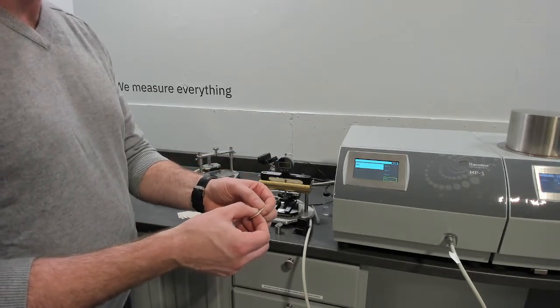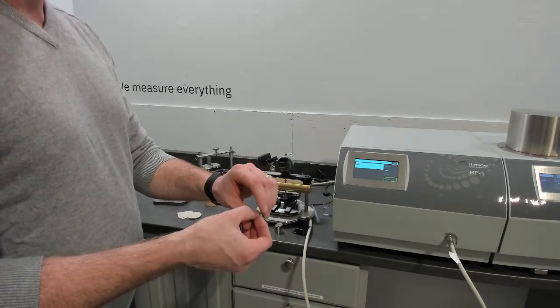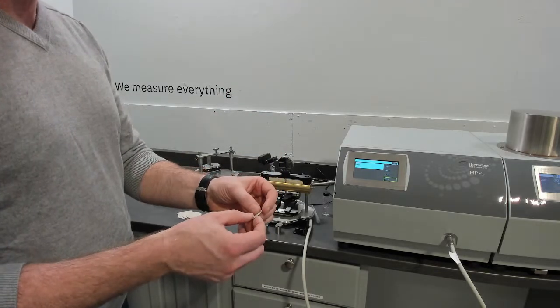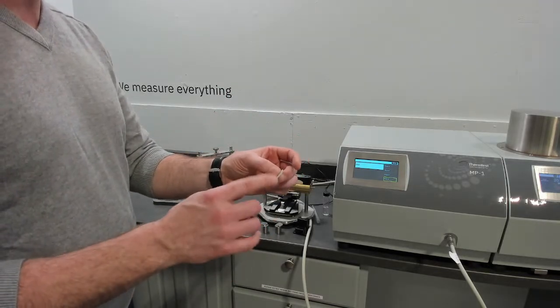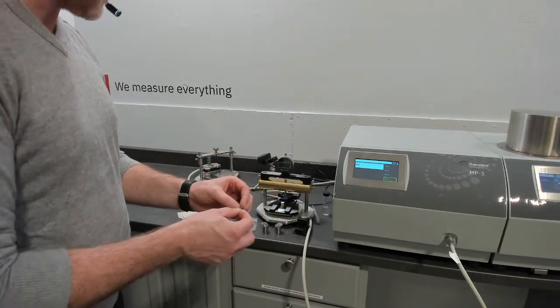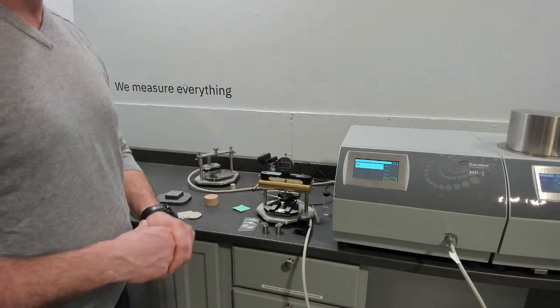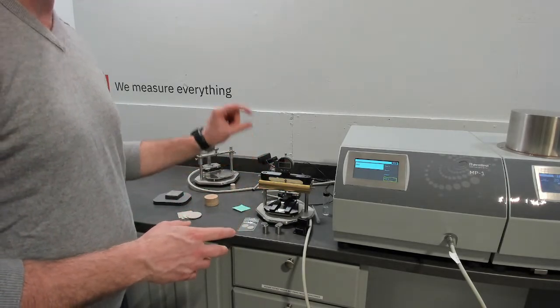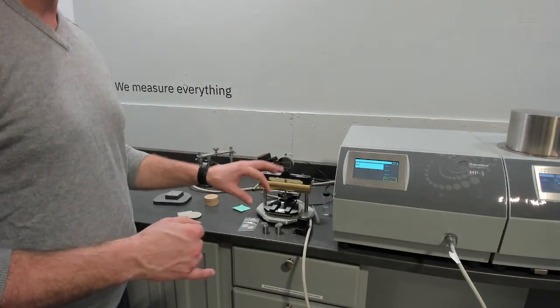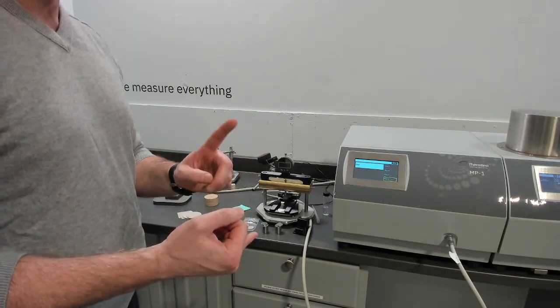So we can measure the 1, 2, and 3 layers of thermal resistance and plot that, and the inverse of the slope, so 1 over the slope, is the thermal conductivity minus the effects of contact resistance between the samples. So that's an important way of determining the intrinsic properties of thin materials. So that can be used to measure a very wide range of thickness because it has this ability to layer out. And that multi-layer approach is the same that's on the other thermal resistance methods that are on the market.